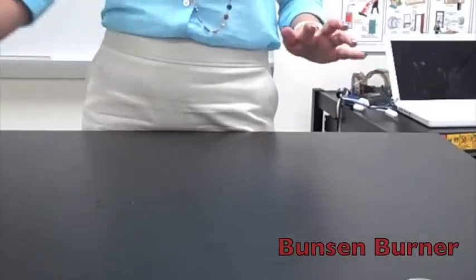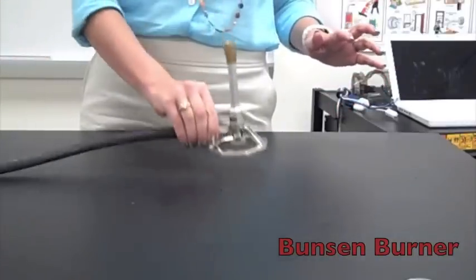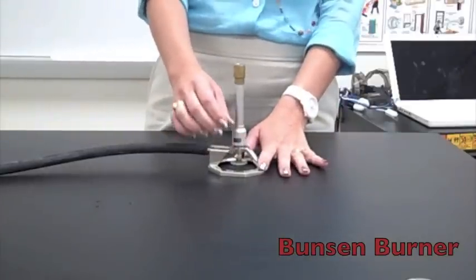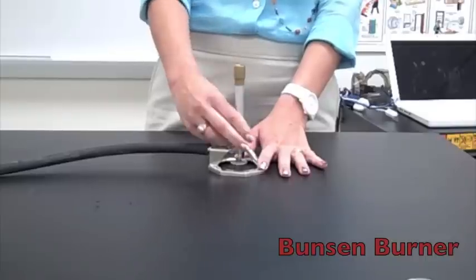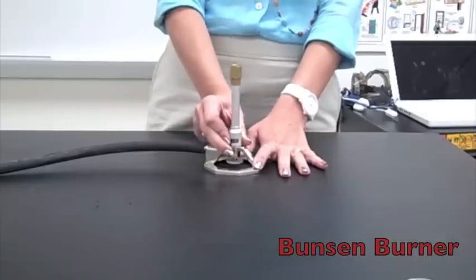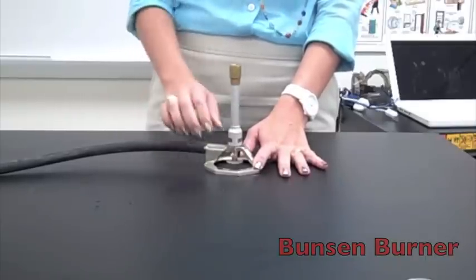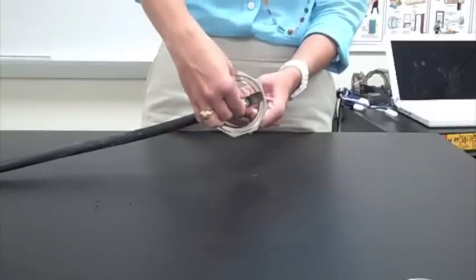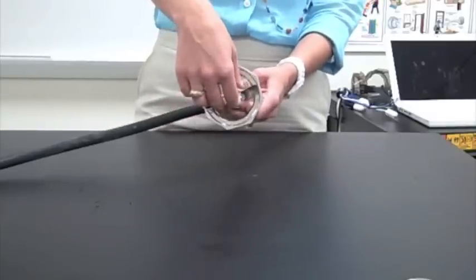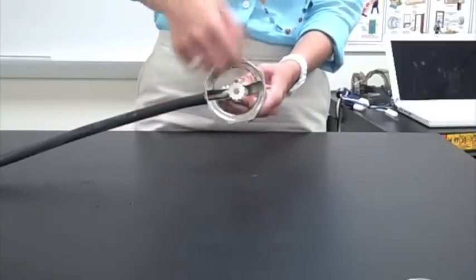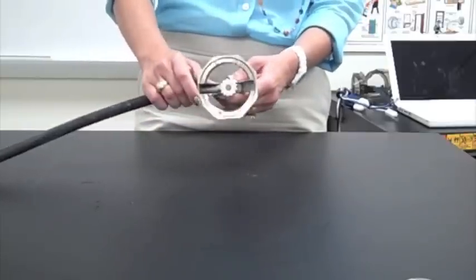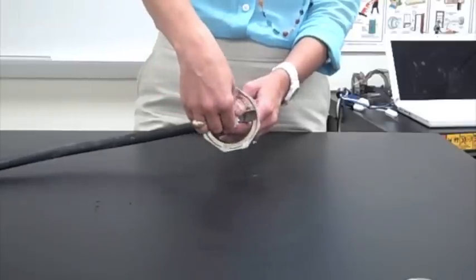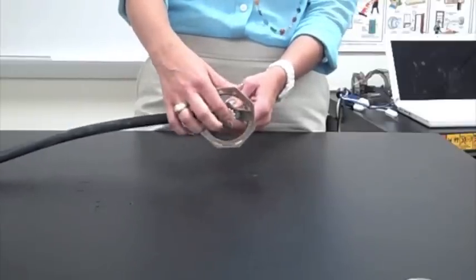For the last part of today, you are going to learn how to use a Bunsen burner. First thing is, how do you light it? Well, you want to take your Bunsen burner. This is the barrel. Close the barrel all the way, and then open it just about half a turn. Just a little bit. And then there is another little knobby thingy down here on the bottom. This actually controls the height of the flame. It controls the amount of gas that gets into the flame. This controls the amount of oxygen that gets in. This controls the amount of, I think it's methane that we have coming through here. Don't mess with this right now. Most of these are set pretty well where they need to be.